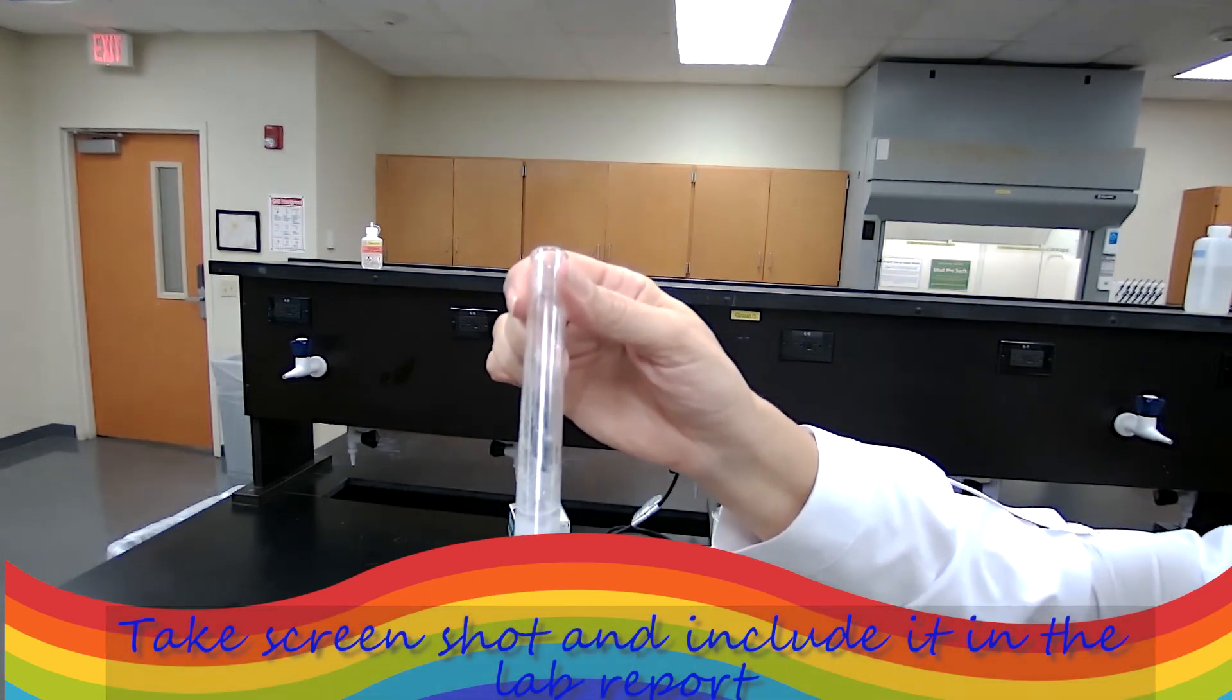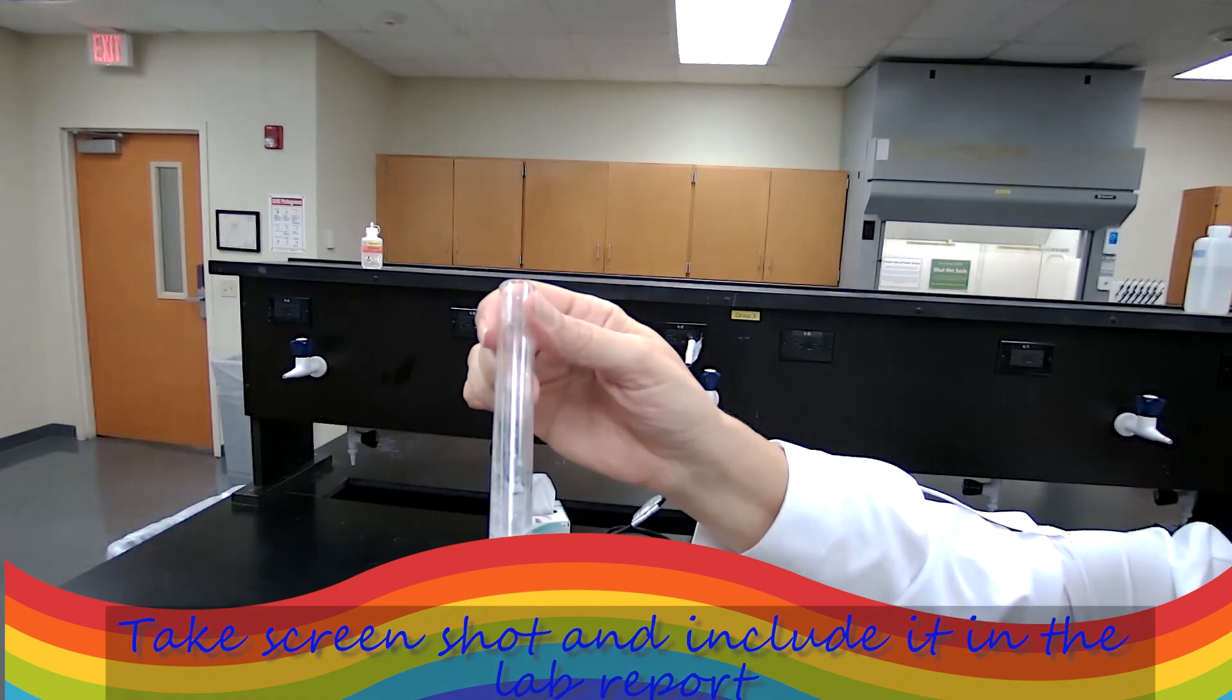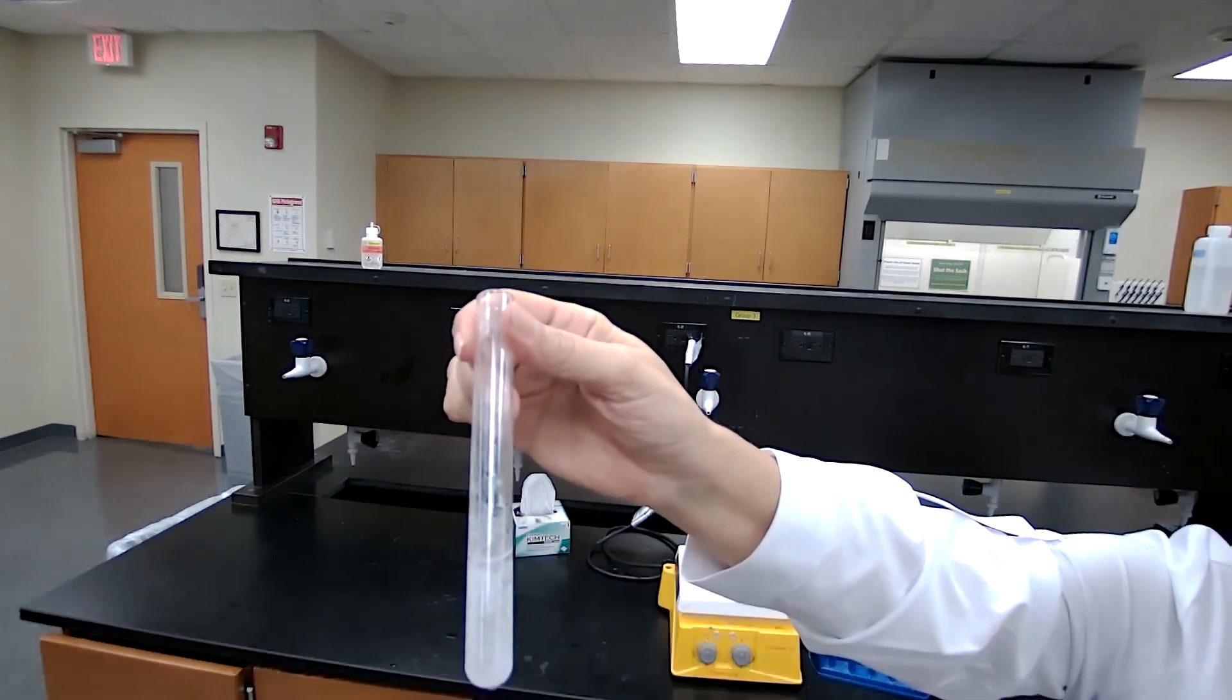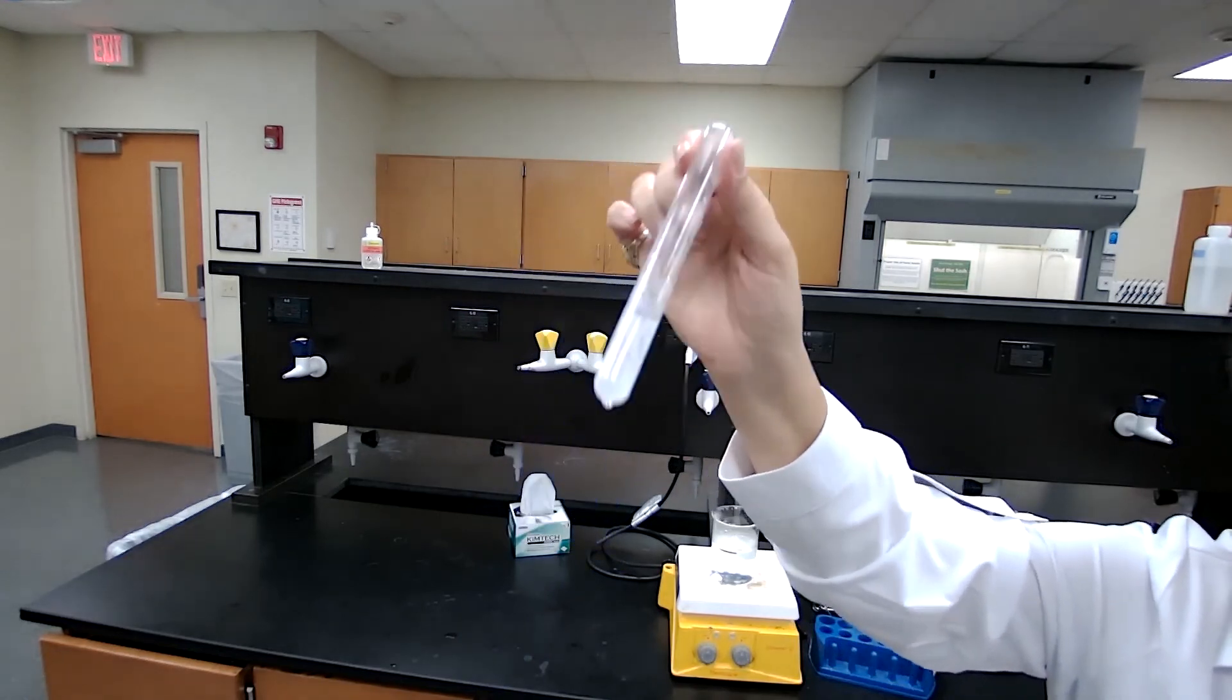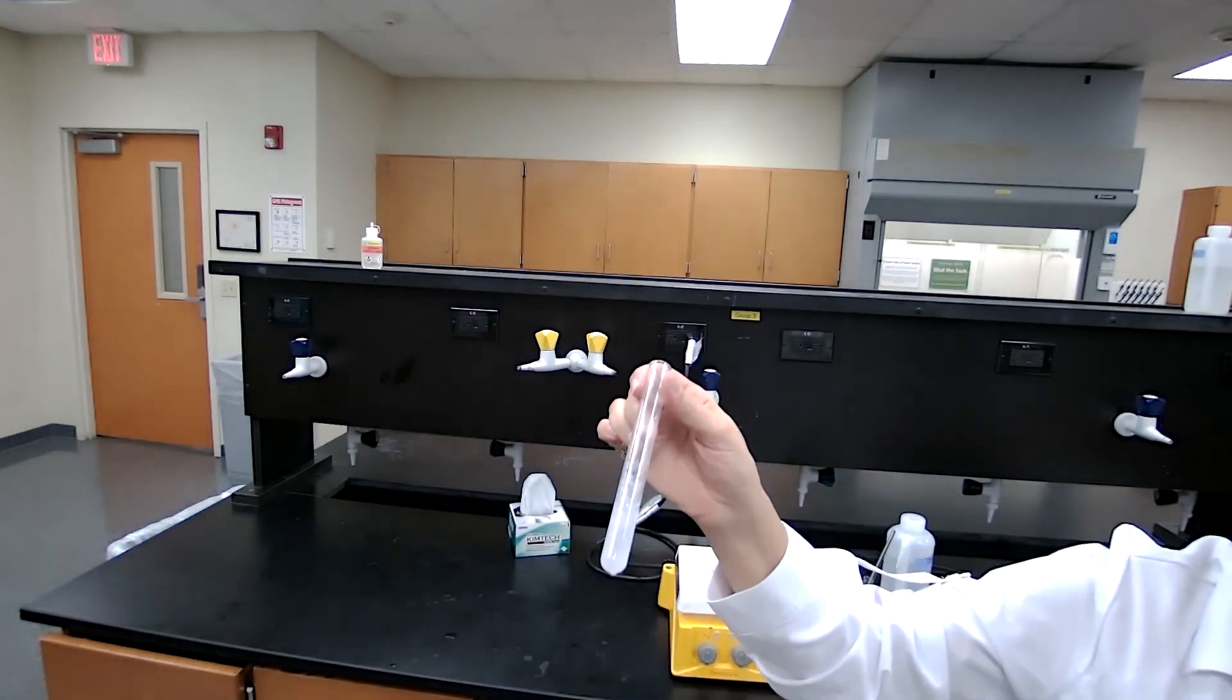We can use water as the crystallization solvent for this experiment. I'm going to move to the next part of the experiment, which is the crystallization of the sample, now that we have our proper recrystallization solvent.